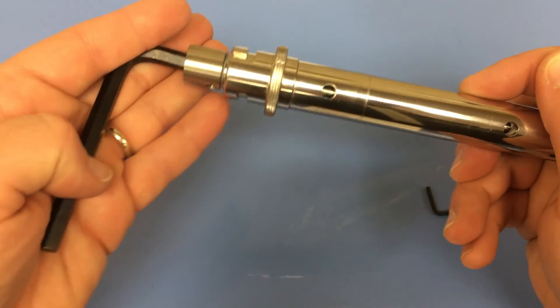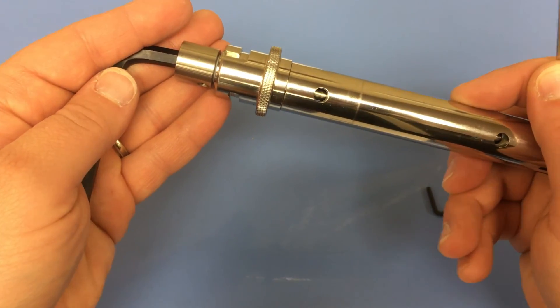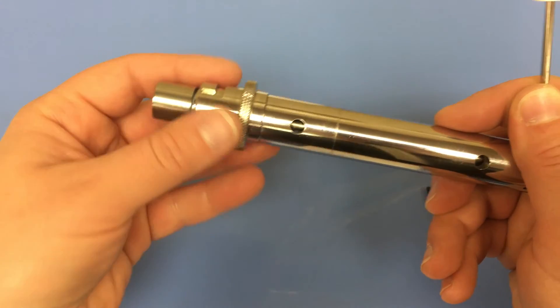Over tightening of the rotor knife onto the rotor shaft can result in breaking of the rotor shaft and or distorting of the rotor knife.